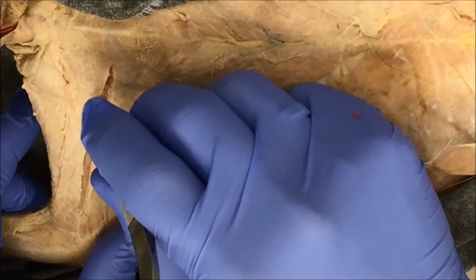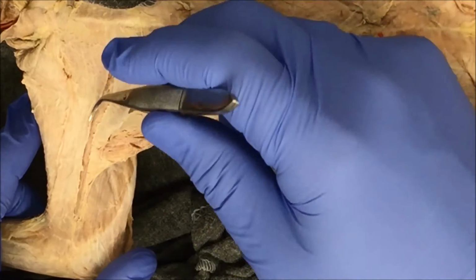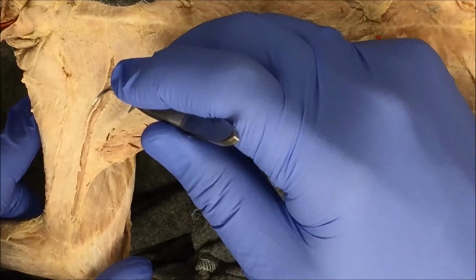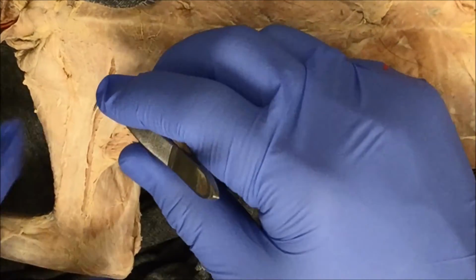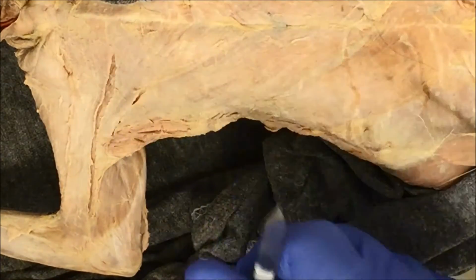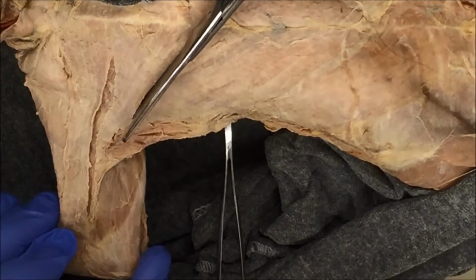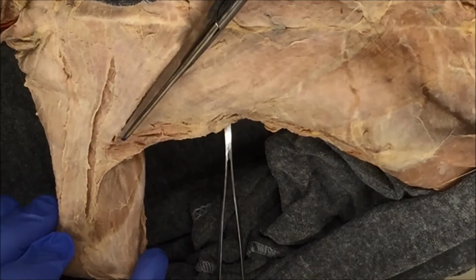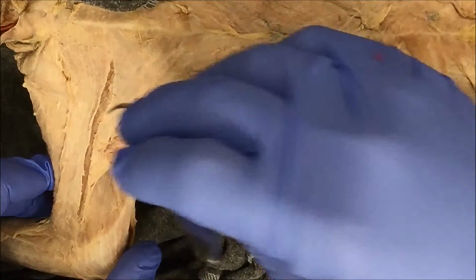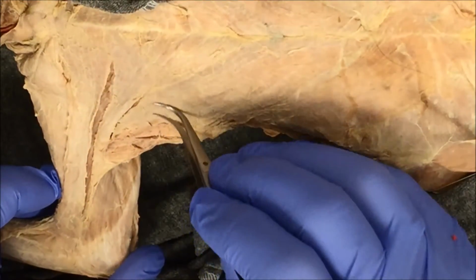So I'm gonna repeat the process, get my forceps underneath, right? See the connective tissue, work on the connective tissue, loosen it up a little bit, and then you can either use your scalpel like I just showed you, or if you have a large enough opening, you can use your scissors. So this time I'm going to use the scissors. I can see that it's connective tissue, short snips. Okay, so I'm beginning again the separation of the pectoralis major from the pec minor.